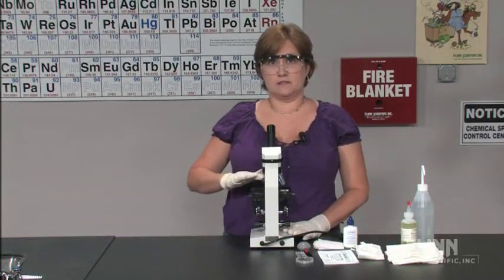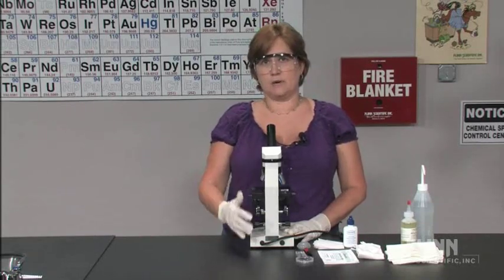To clean a microscope, we're going to start at the top. We're going to clean the ocular, then the objectives, then the substage and the light source, and finish up with the stage and the body.